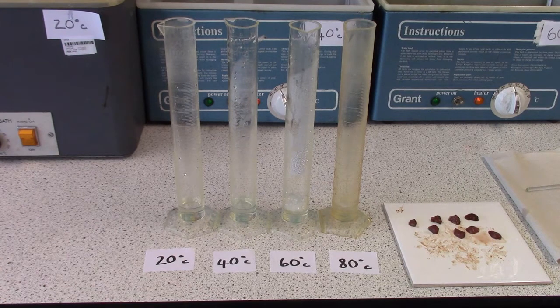I am going to try to quickly put one piece of liver into each measuring cylinder and we are going to look at the volume of froth produced. Before I do that though, I am going to quickly make sure that I have detergent in. I have already put detergent in, as I reminded myself by finding my pipette.